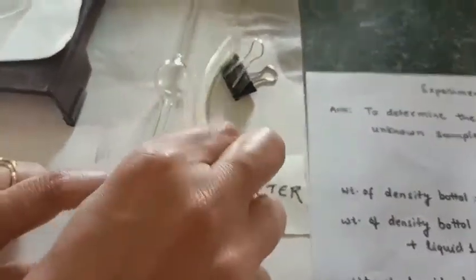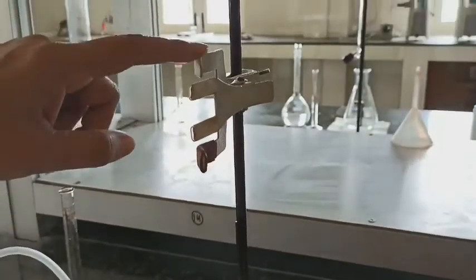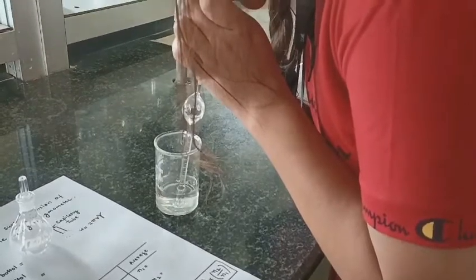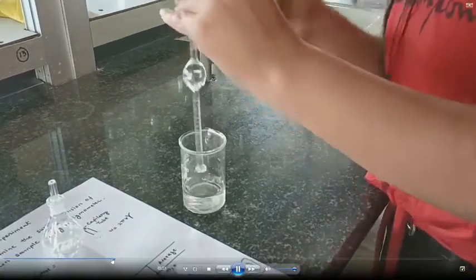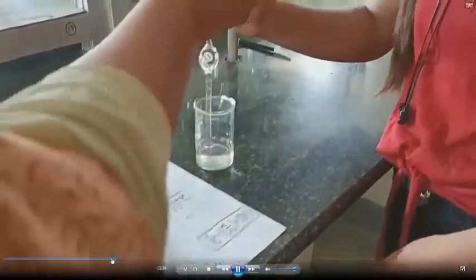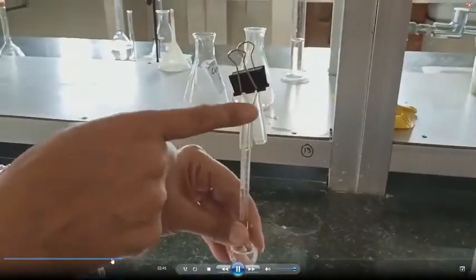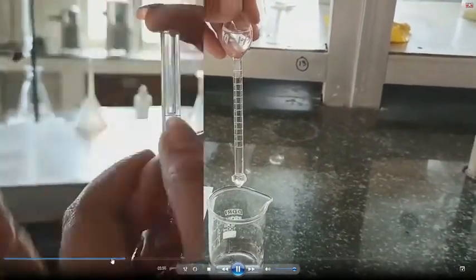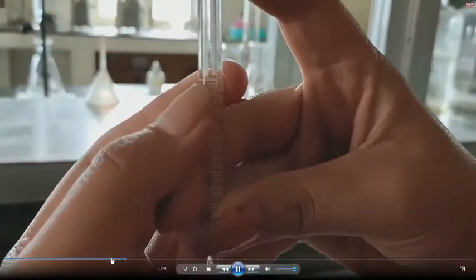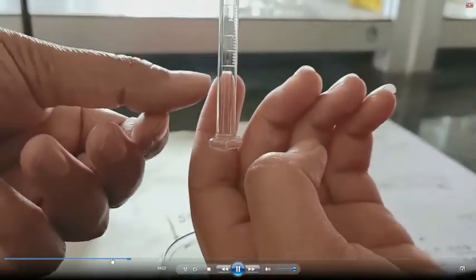This is our stalagmometer. We require one rubber tube, one paper clip or some other clip, and one beaker. This is a burette stand. We will first fill it with liquid one, that is water. We add the rubber tube to the stalagmometer and adjust it to maintain the pressure controlling how the drop falls. This rubber tube helps maintain the pressure. This is mark A from where we start — we read the lower meniscus — and mark B is where we stop counting the drops.